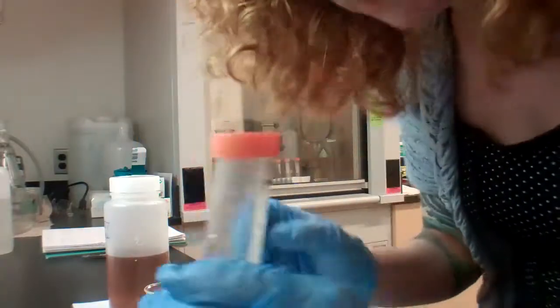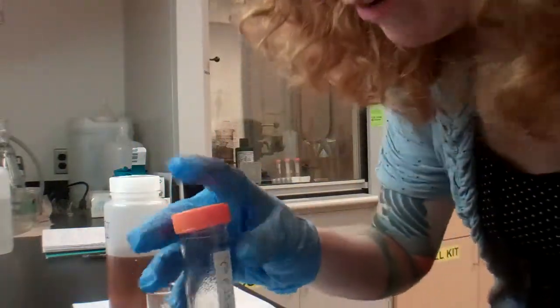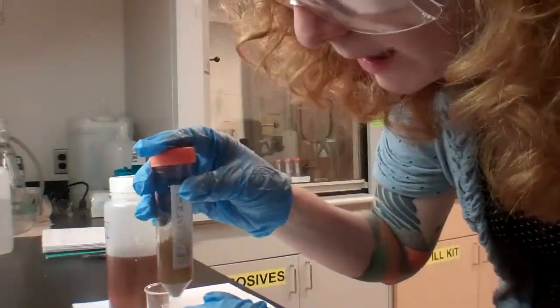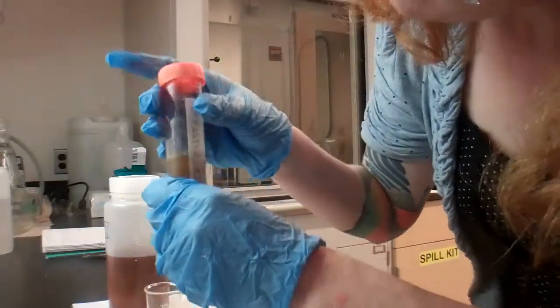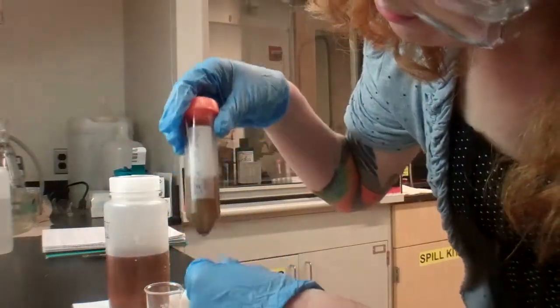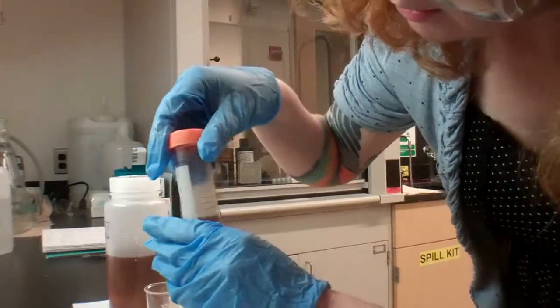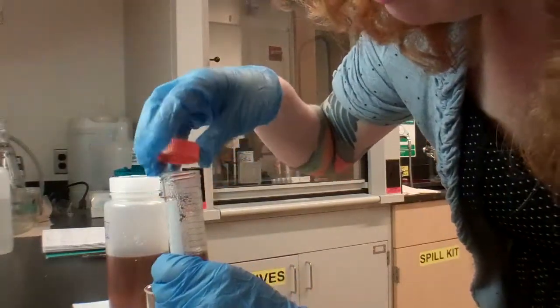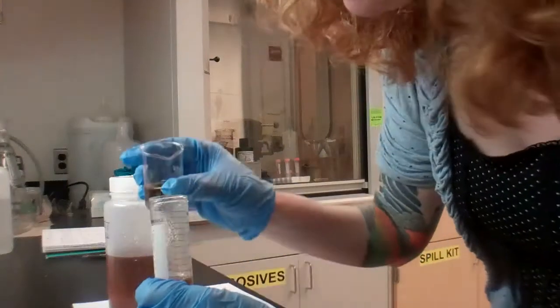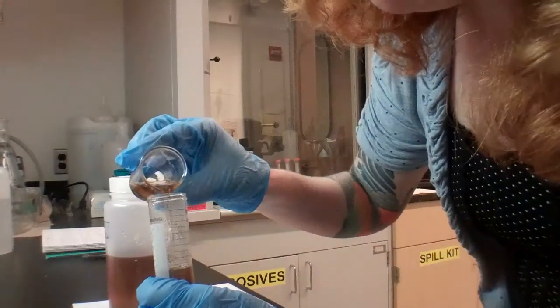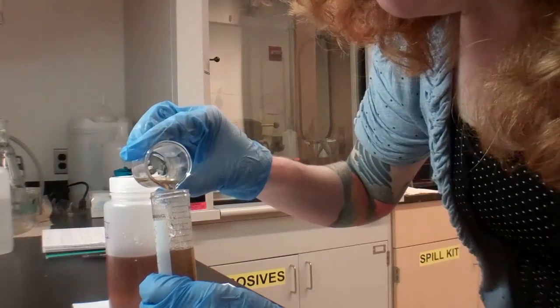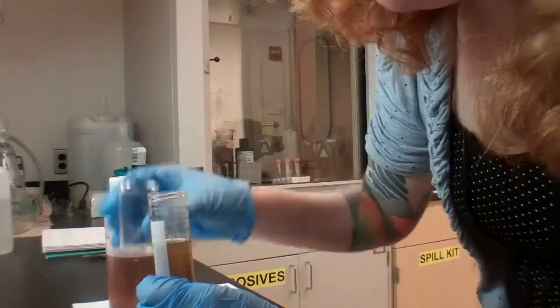This is why I have gloves on, the paper down, just in case there's any spillage. Okay, that looks good. It looks like it's all spread out, so I'm going to fill it up a little bit more. Great.